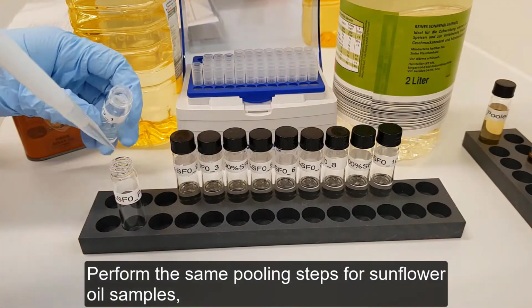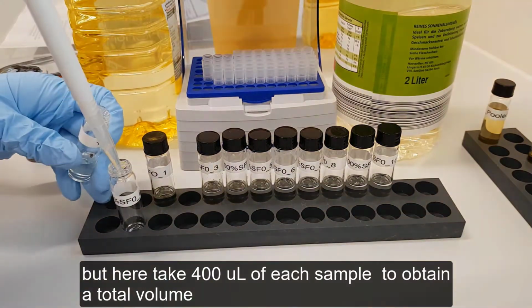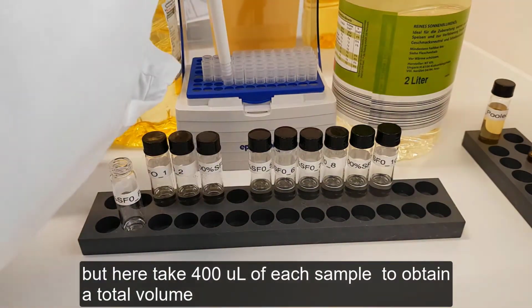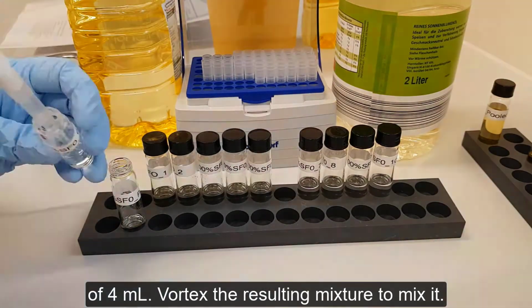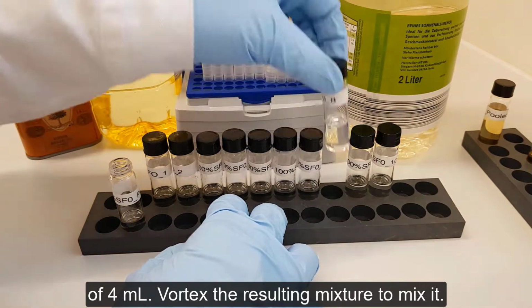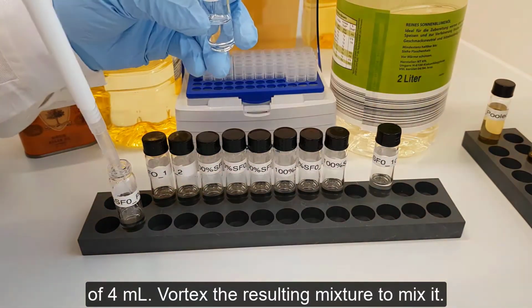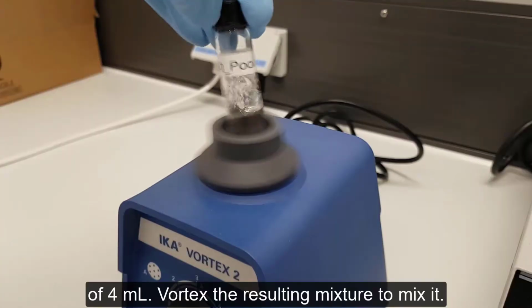Perform the same pooling steps for sunflower oil samples, but here take 400 microliters of each sample to obtain a total volume of 4 milliliters. Vortex the resulting mixture to mix it.